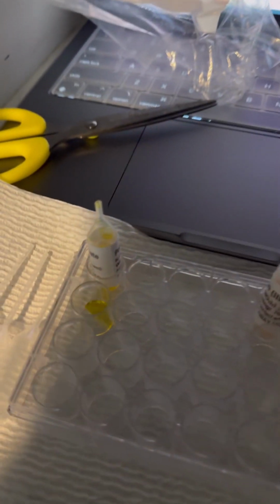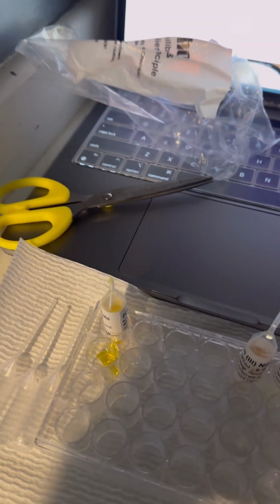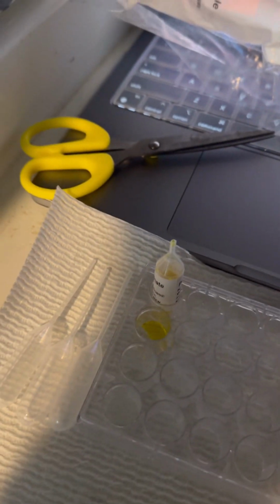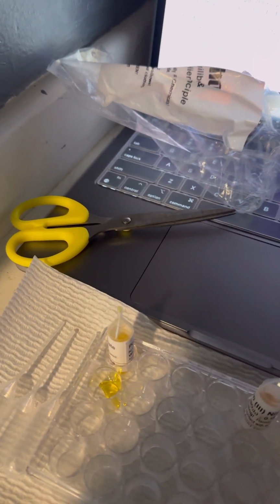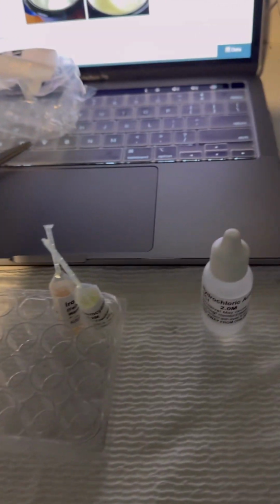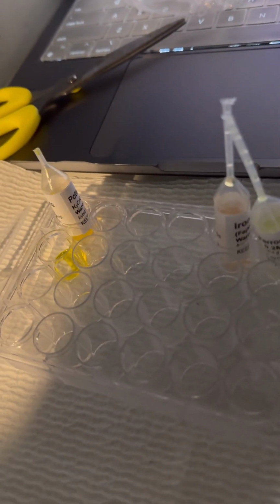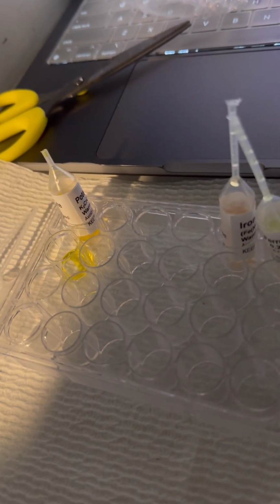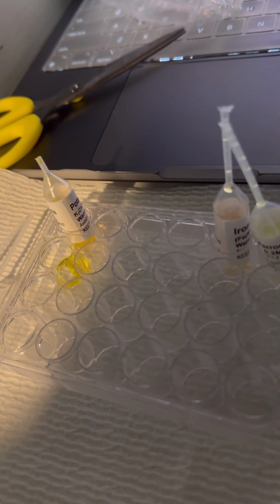It says to record the color of the chromate in the well plate in data table 1. As you can see, it's a bright yellow color. So I'll record the color and we'll continue. Next it says to add 4 drops of hydrochloric acid, which is right here, to the potassium chromate, and this will push the reaction towards the product, so the resulting color change should indicate the formation of dichromate.